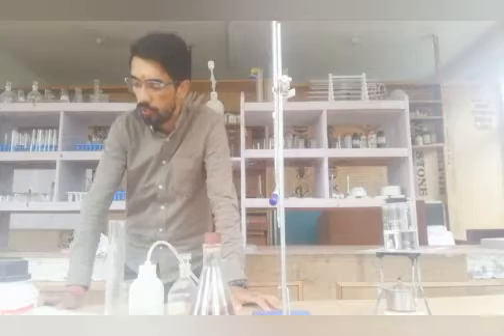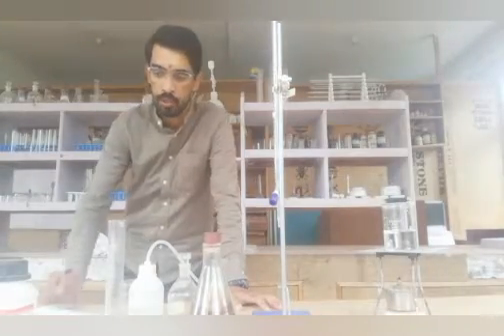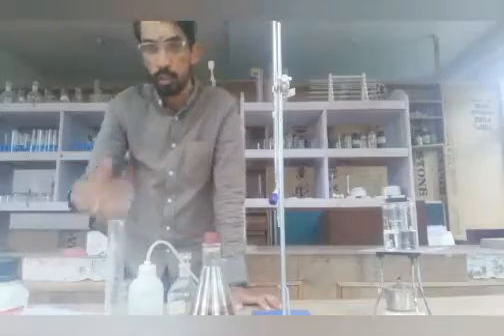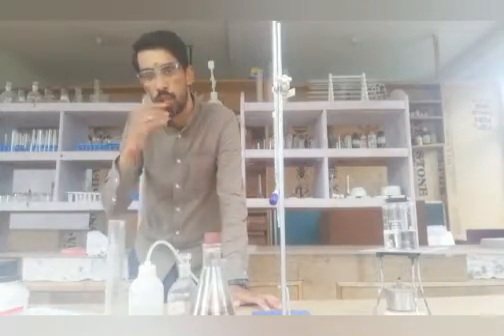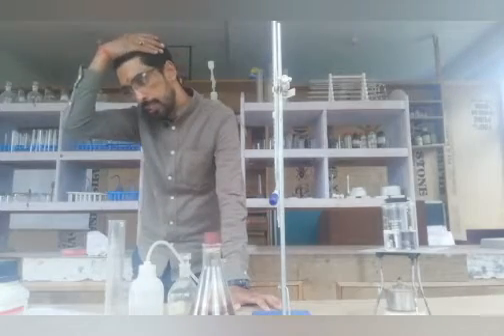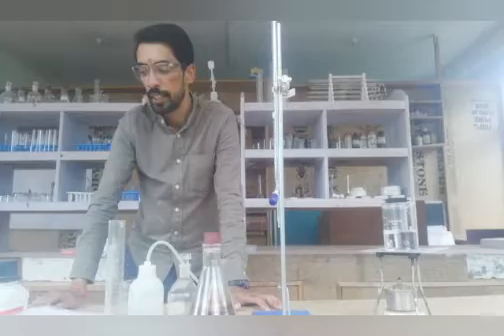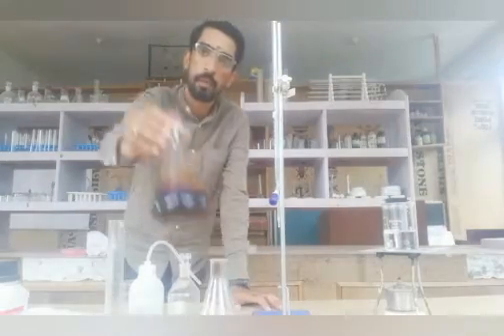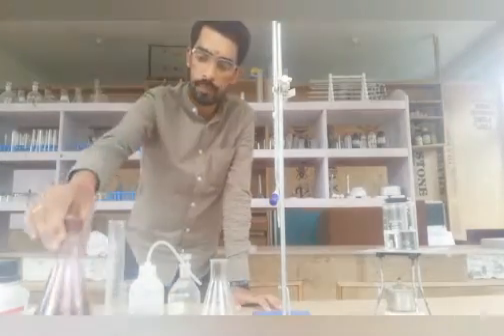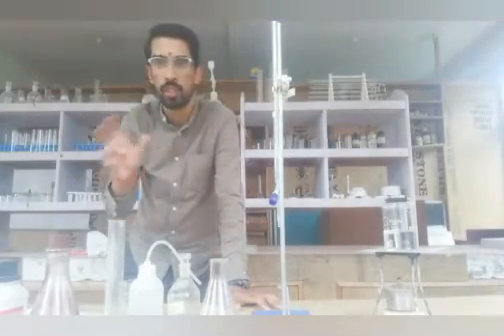For that purpose, there are two solutions. Number one is M/50 Ferrous Ammonium Sulphate — this is also called Mohr's Salt, so don't be confused if it is written as Mohr's Salt; it is the same. Second, with the help of this salt we can determine the molarity of the given KMnO4 solution. This is the purple colored solution, that is KMnO4. Both solutions — we will do volumetric analysis, we will do the titration of both.